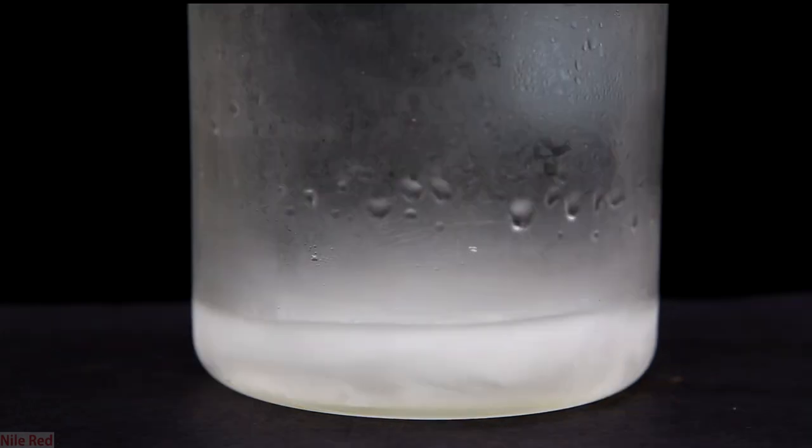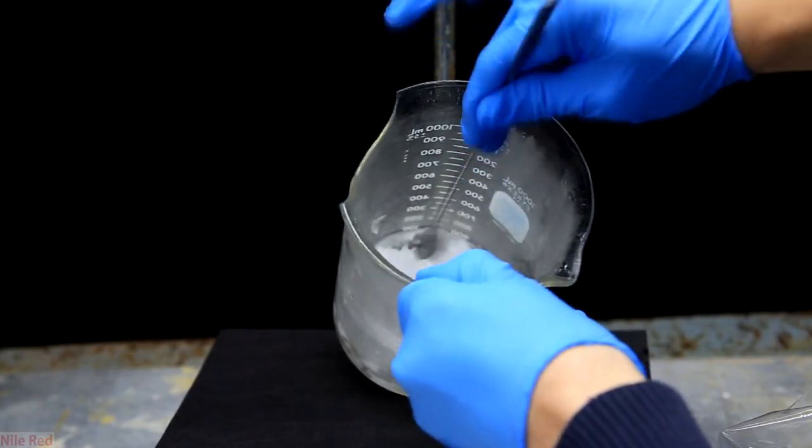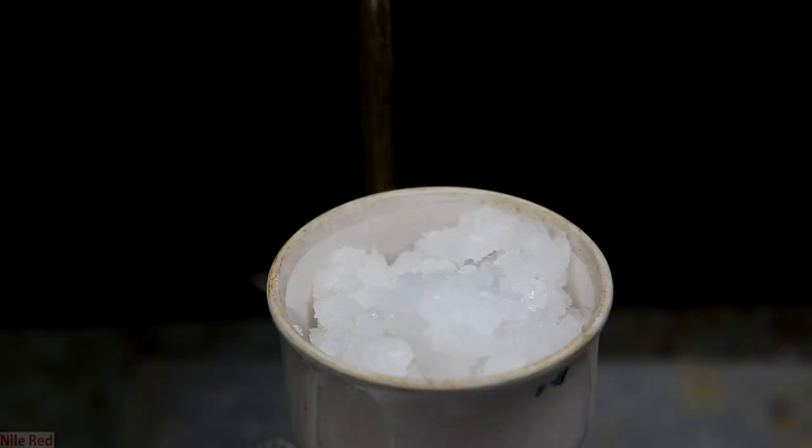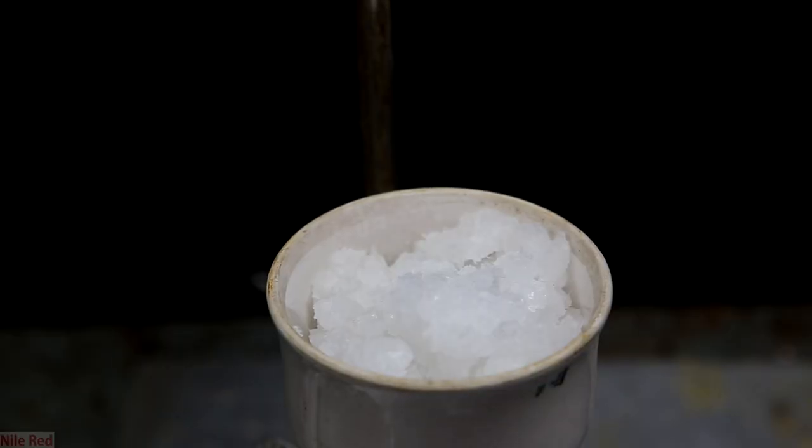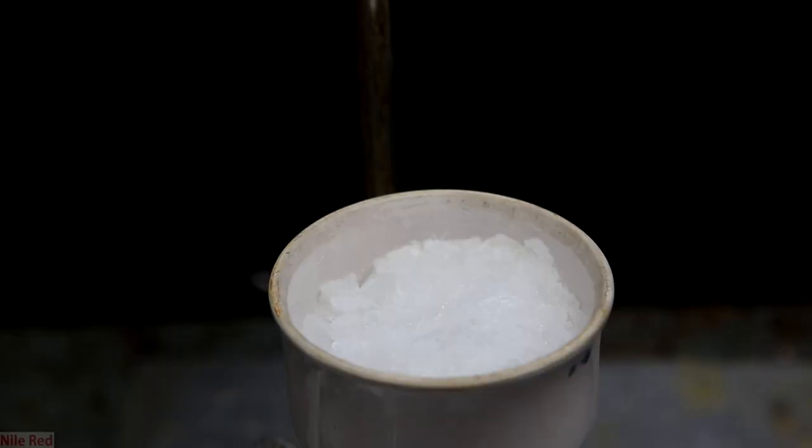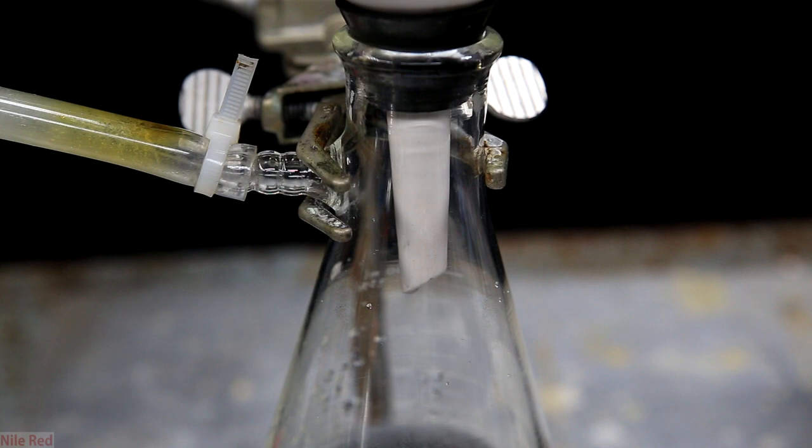Just to fully crystallize everything, I placed it in a freezer. Afterwards, I broke up the clump of ammonium formate. It was then transferred to a vacuum Buchner funnel to dry it. As I pull air through the funnel, you can see excess water dripping out the bottom. I keep pulling air through until this dripping more or less stops.